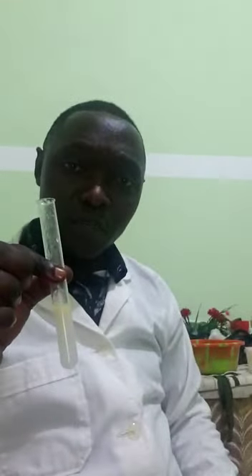The cloudy white suspension is formed because an emulsion of tiny lipid globules in water is formed in the presence of ethanol, which reflects light, forming a cloudy white appearance within this mixture. So you see, lipids can be tested this way. They can also ask you now to state the functions of the various nutrients that are found in food samples. You take, for example, proteins.